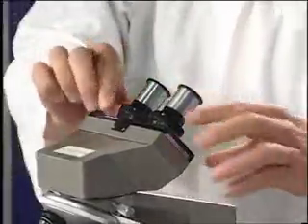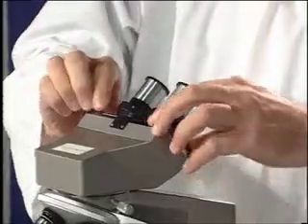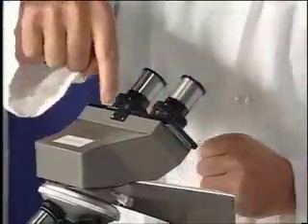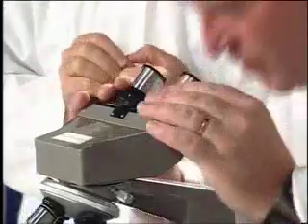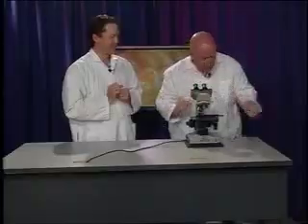Because everyone's eyes are set slightly different within their faces. Mine are fairly narrow. We can move them back and forth. Oh, okay. So we just pull this side to side. There's also a little scale on top there. So once you find a setting that's comfortable, if you make a mental note of that, you can automatically go back. Let me see. Oh, I like right there. Perfect. I'm a 53.